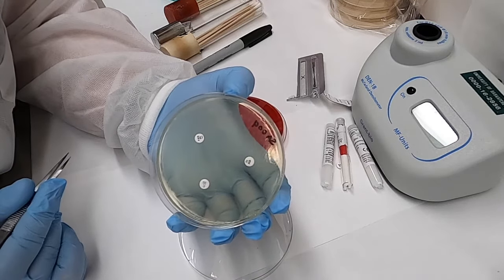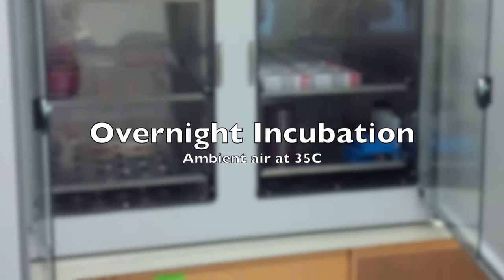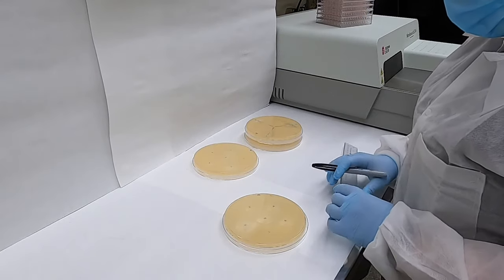Once all of our disks are planted, the next step is to incubate the plate. We do that overnight at 35 degrees Celsius in ambient air.